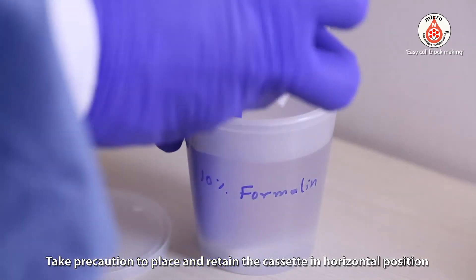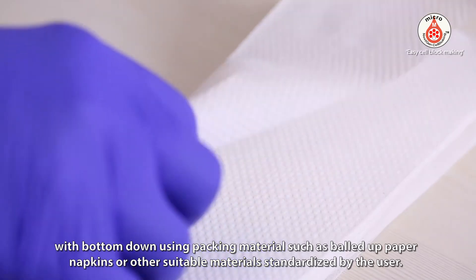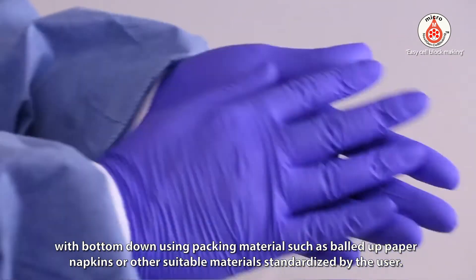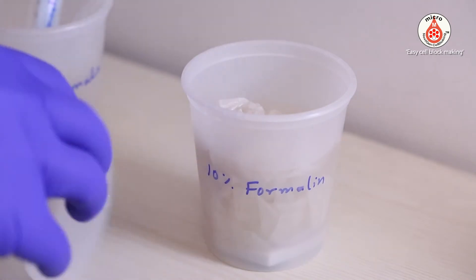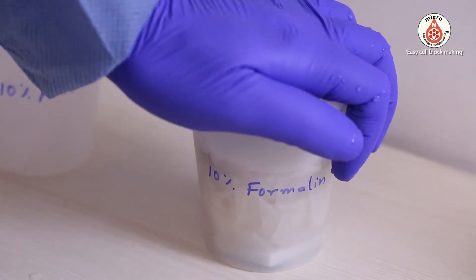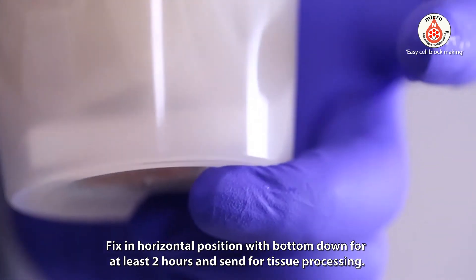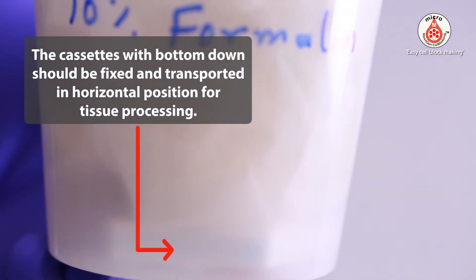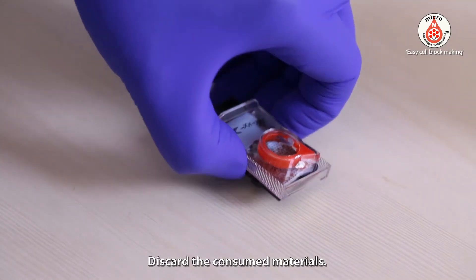Put the closed tissue cassette with the final sponge disc into the transfer container with 10% formalin. Take precaution to place and retain the cassette in a horizontal position with bottom-down, using packing material such as balled-up paper napkins or other suitable materials standardized by the user. Fix in horizontal position with bottom-down for at least 2 hours and send for tissue processing. Discard the consumed materials.